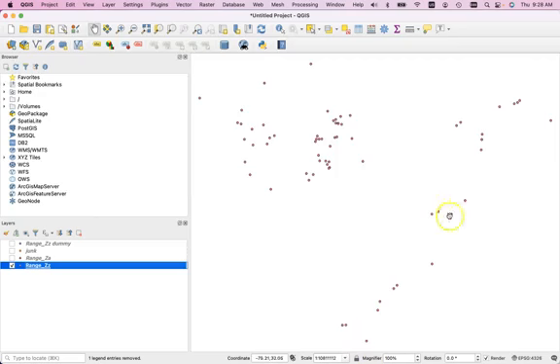So I think it's that the unusual geometry here, of having one group of points that are all spread out like this in a line and another group of points all spread out like this in a circle, has twisted the geometry to its limits in the calculations. I suspect that there's some triangles where one of the sides is extremely short and that it's being rounded down to 0. And so it's creating this bisection error.